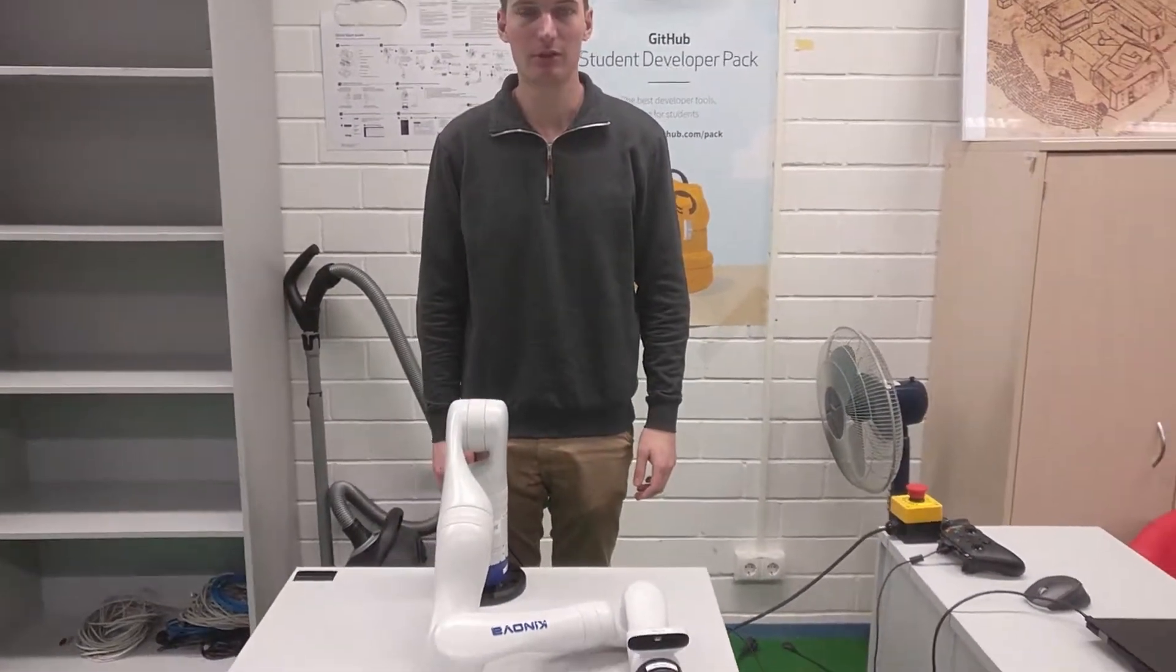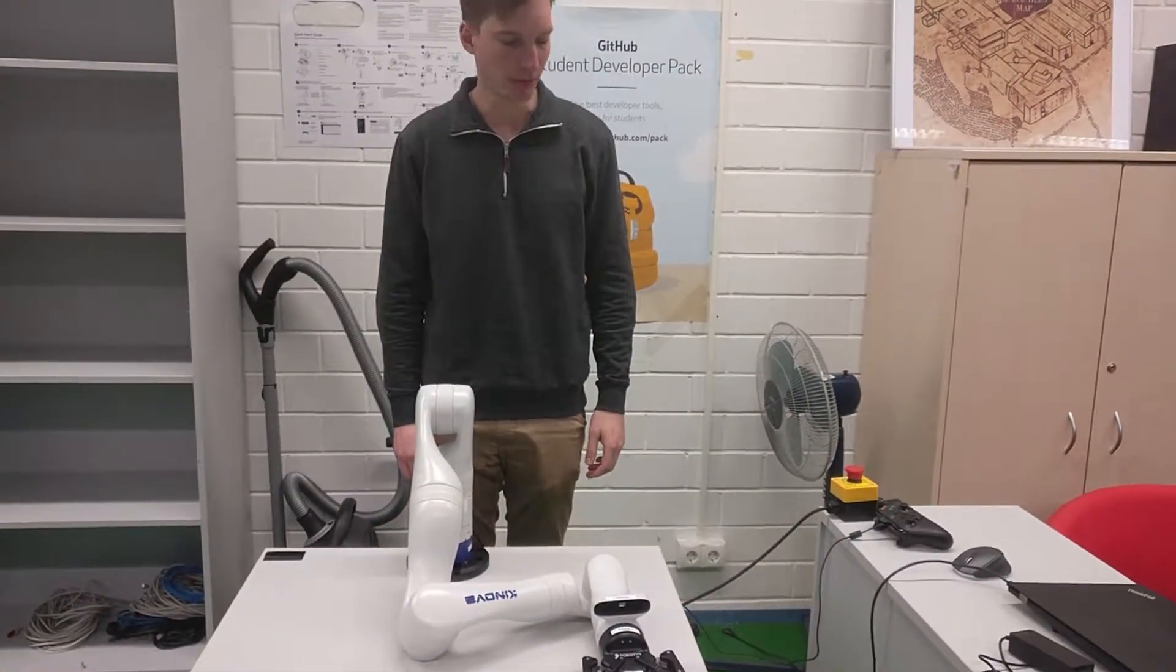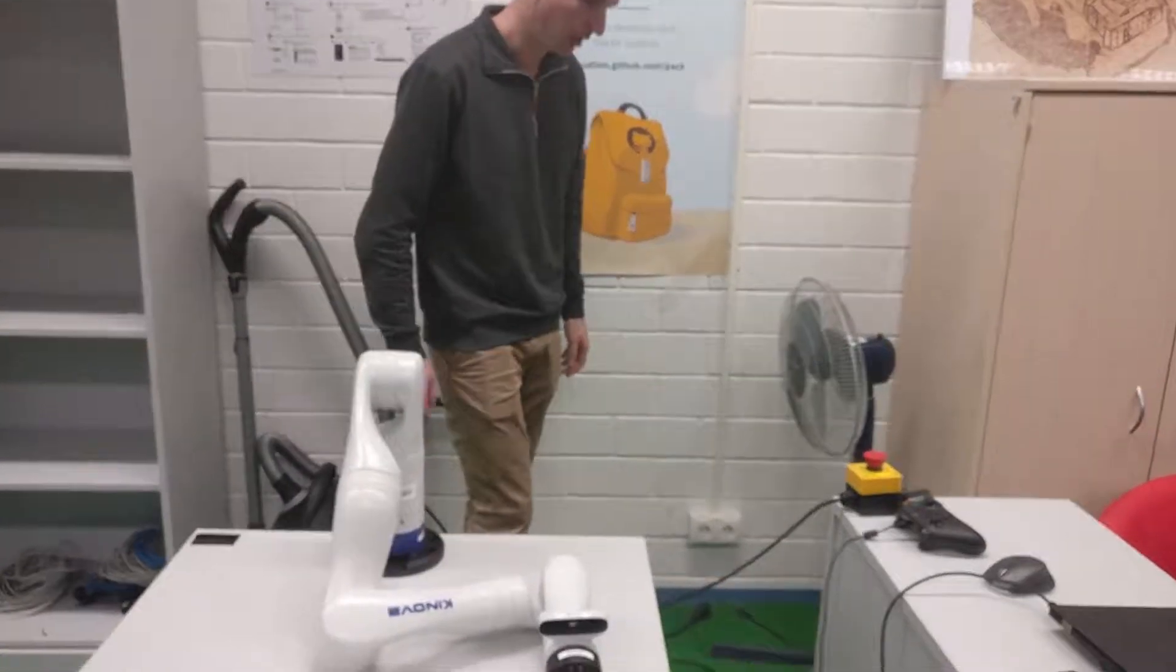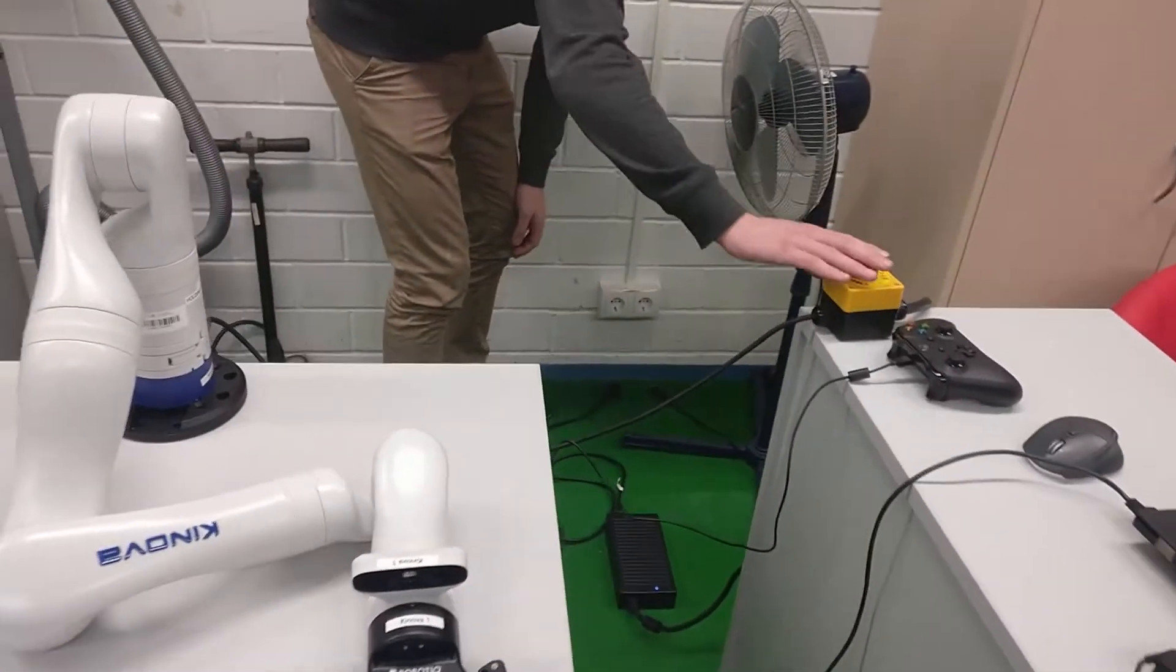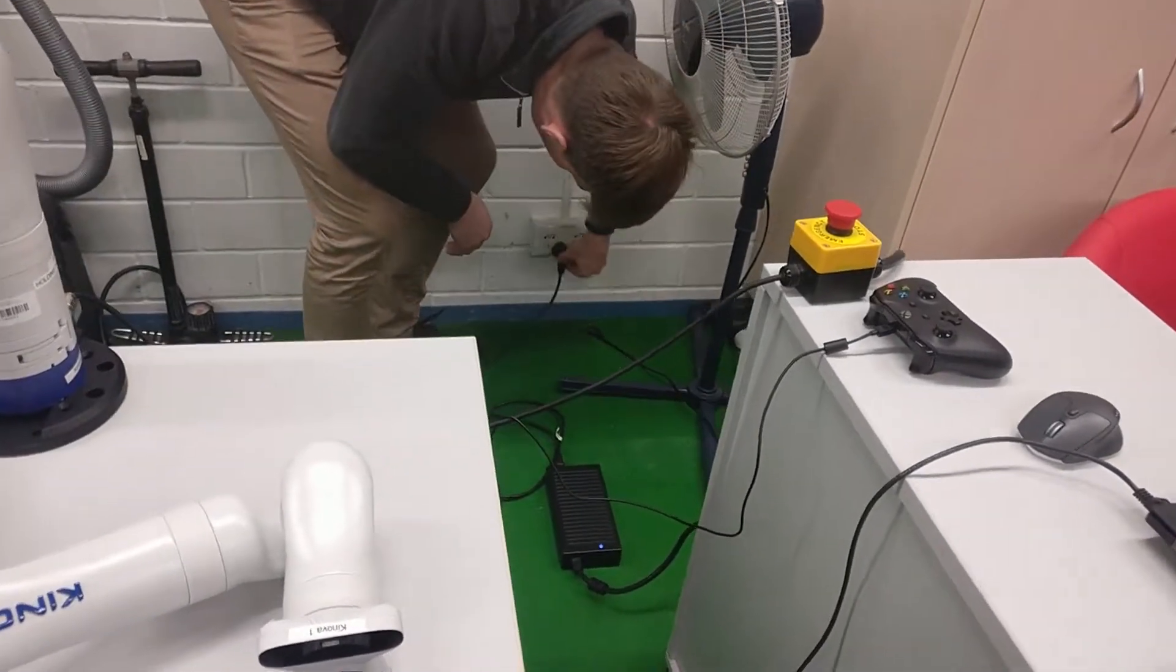This is the power and start-up tutorial for the Kinova robotic arm. When powering up the device, you need to make sure it's on stop, then plug it in.